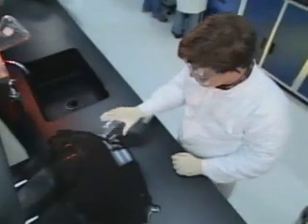Oh my, looks like our first accident of the day. We have a spill. How did that happen? Well, it looks like someone got a little careless with a beaker, Mia.